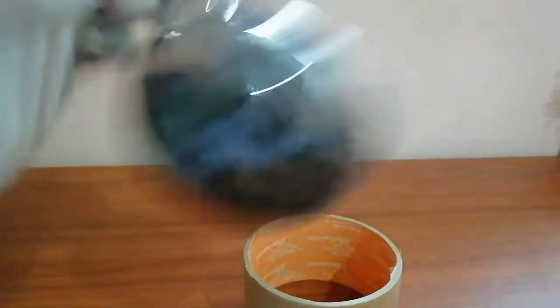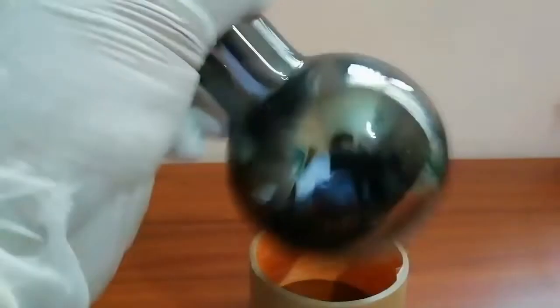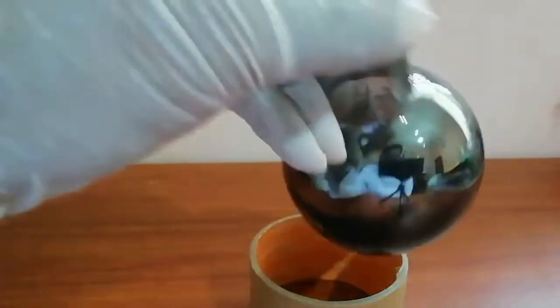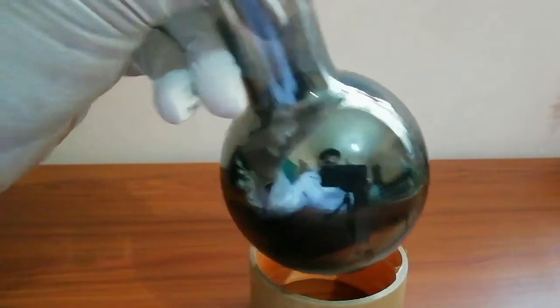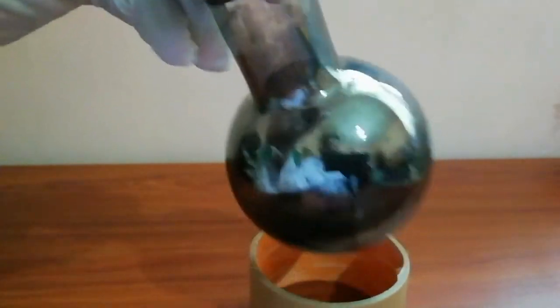20 milliliters. Now you can see the mirror has started to form.